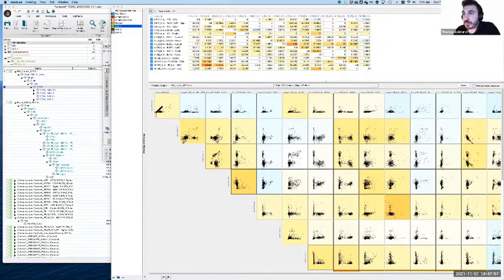Yeah, there's absolutely some super negatives here, and because this x-axis now becomes the y-axis here, you can actually see it occurring in multiple detectors. So very well spotted, and that indeed becomes a problem which we'll tackle. This one is kind of interesting, because in a way it looks like this is actually leaning, right? Let me just clean this up a little bit. As it's getting positive, it's leaning over to the right. This one we'll investigate as well, so we'll put that on the red flag list.